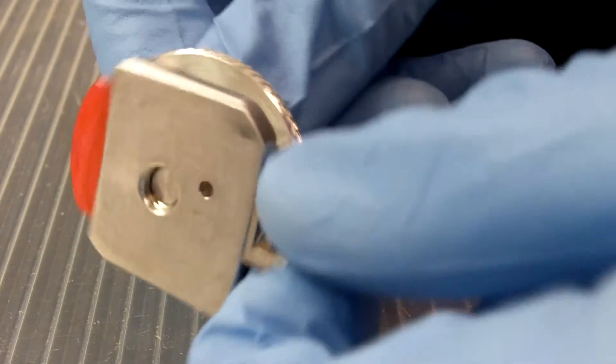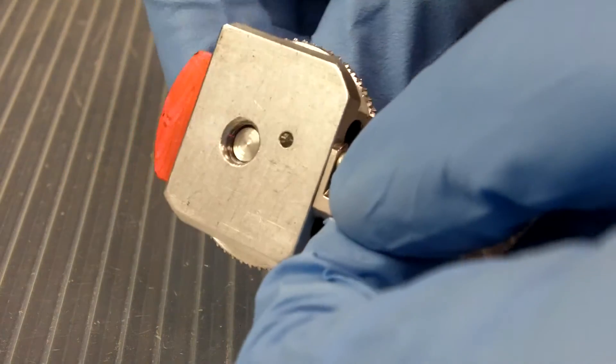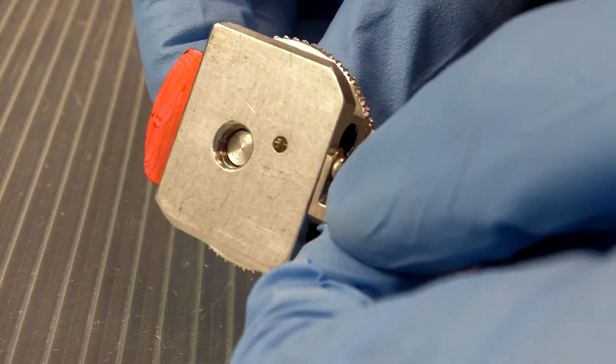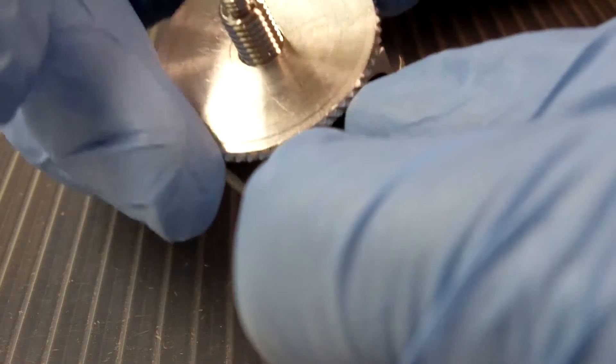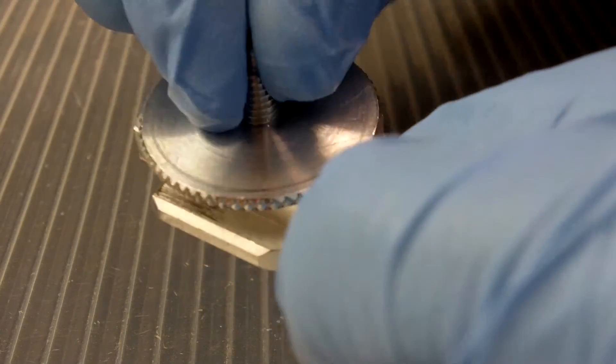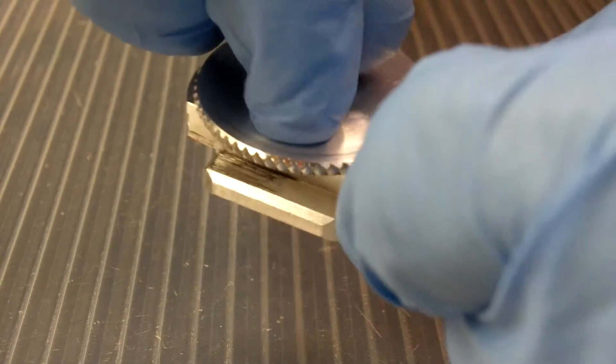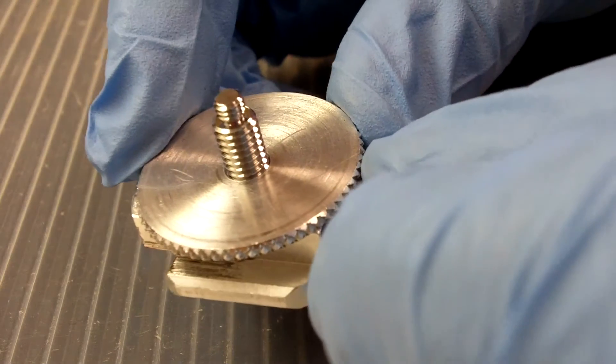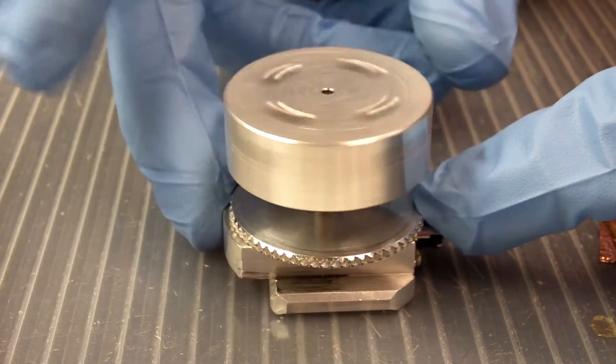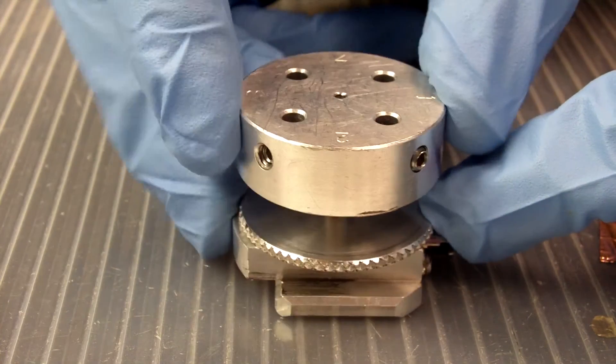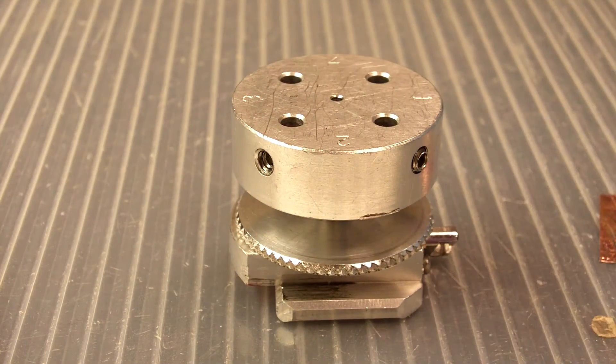So we need to make sure that the screw is not all the way at the bottom of the base before we tighten the locking ring. And we need to make sure that the locking ring is tight enough. And we'll know that it's tight enough if we cannot turn this screw. If you can turn this screw, the locking ring is not tight enough. The last issue we have is the platform. And it's easy to screw it on so tight that it will not come off. And this right here is about how tight it needs to be.